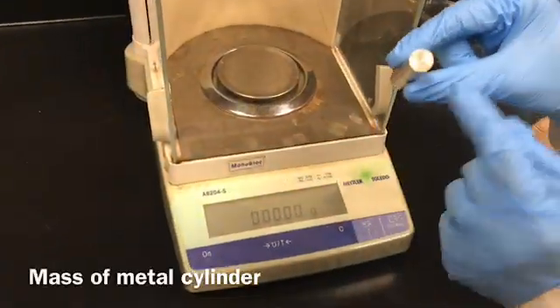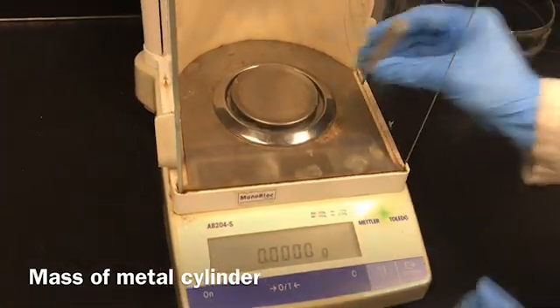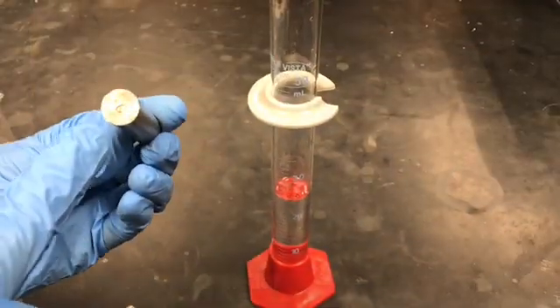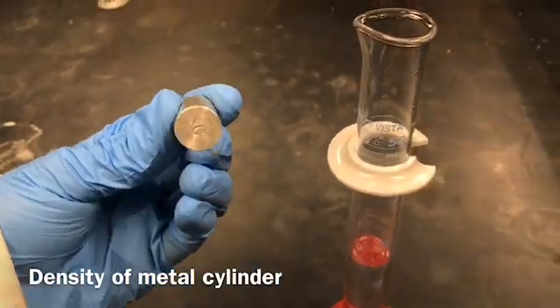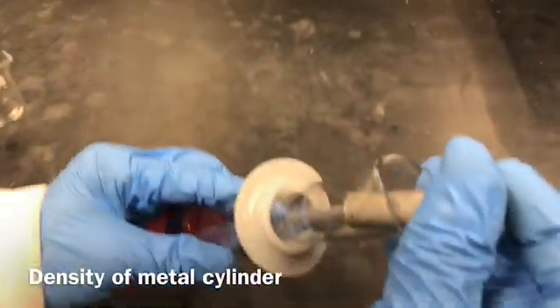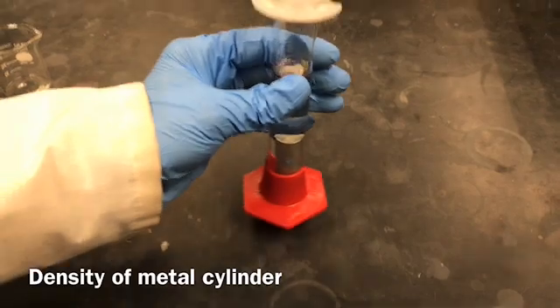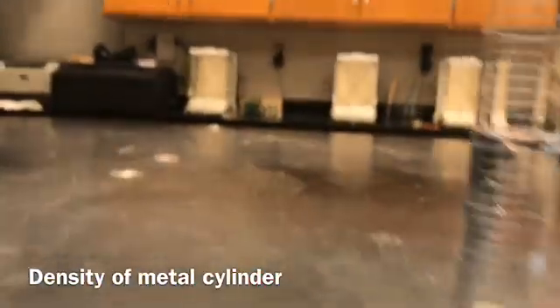So here I'm going to record the mass of metal cylinder C. So now I have here a metal cylinder. The number is C. I'm going to roll it down very slowly into the measuring cylinder. And you can record the volume displaced.